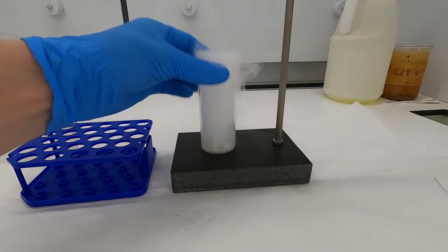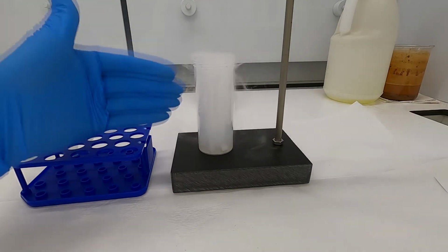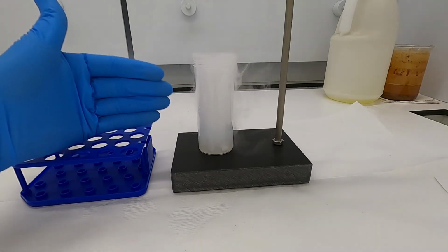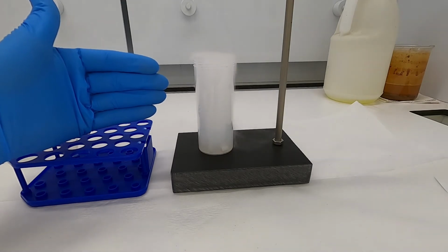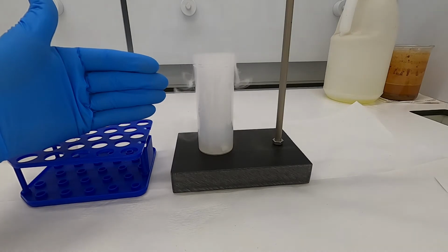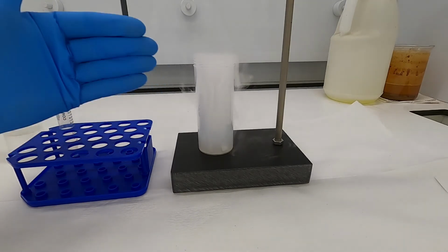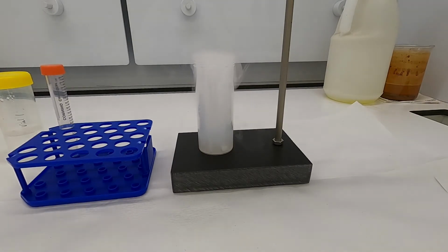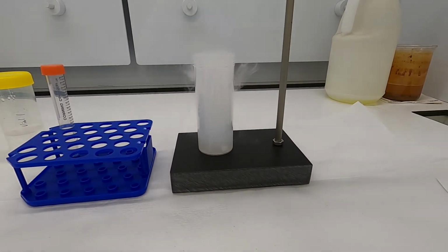So this demonstration is a bit on the extreme in that we have an atmosphere composed of 100% carbon dioxide, but you can still understand the general concepts behind some of the risks that we face as we continue to increase the concentration of carbon dioxide in our atmosphere. As we do so, more CO2 will be absorbed by the oceans.